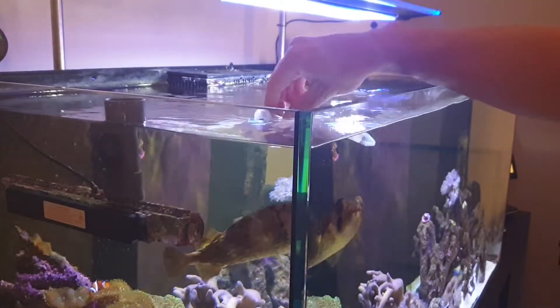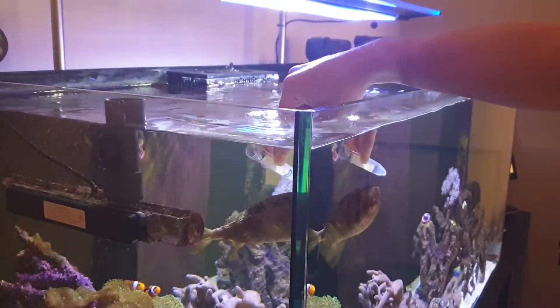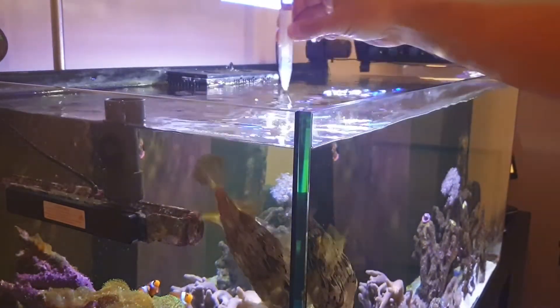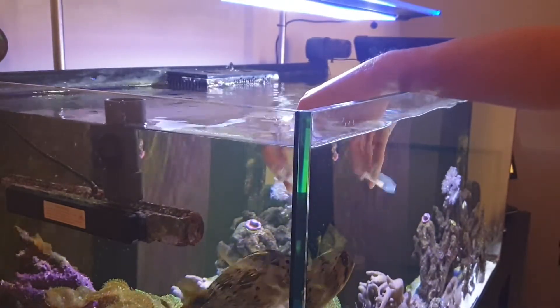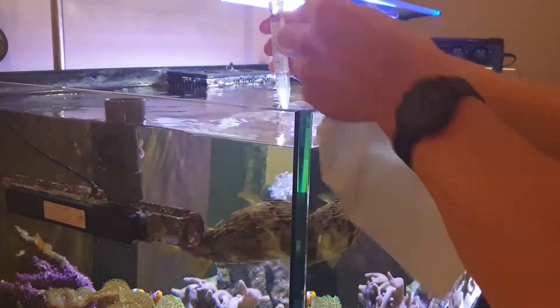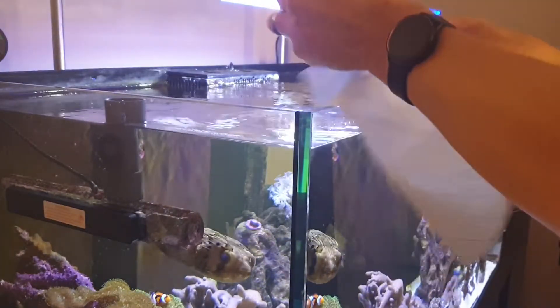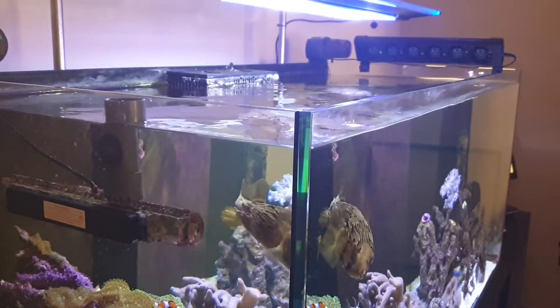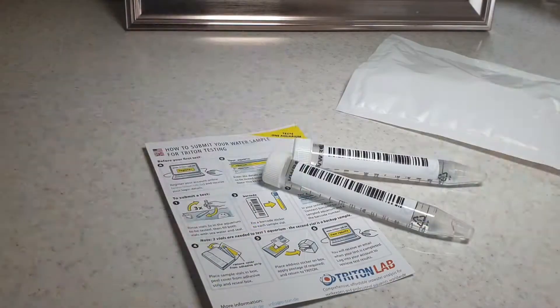I'm only going to do one but you'll get the idea. Basically we're going to fill this up, rinse it out — we'll do that about three times. And then the last time will be the actual sample we take. We want to make sure there are no air bubbles in there, then screw the little cap on. I've got a bit of kitchen towel to dry it, and I'll do the second one off camera.